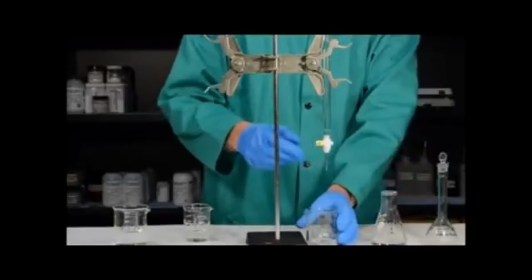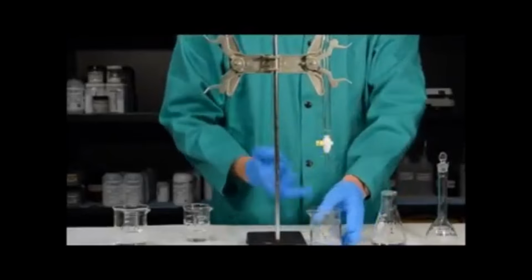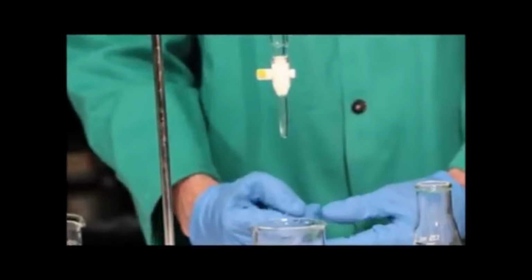To remove the air bubble, you simply, using the waste beaker, open the burette for a second or 2 and make sure that there's no air bubble present. Now that we've filled the burette up and removed the air bubble from the stopcock, we need to take the initial burette reading. To do that, you generally want to use something white. In this case, I have a white paper towel. You could use a piece of paper or anything else that's white because it provides contrast and allows you to be able to read the numbers more clearly.